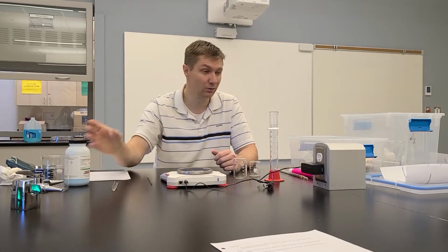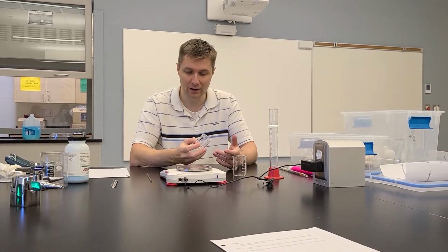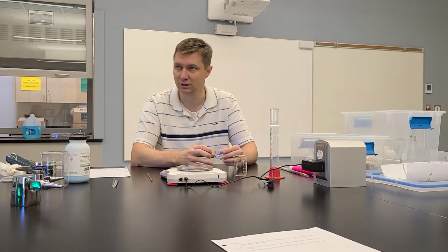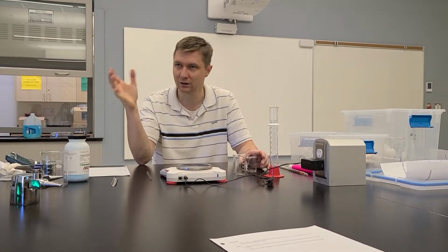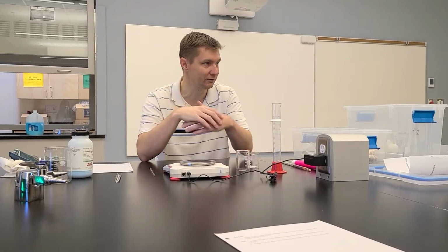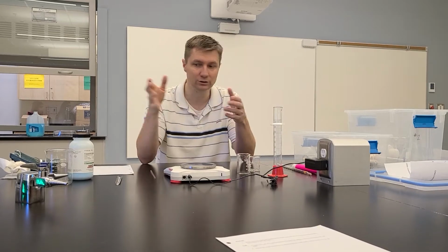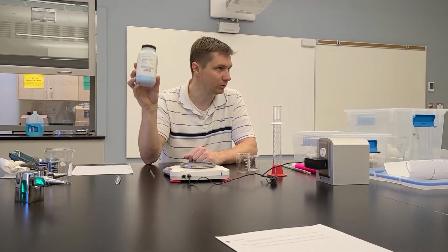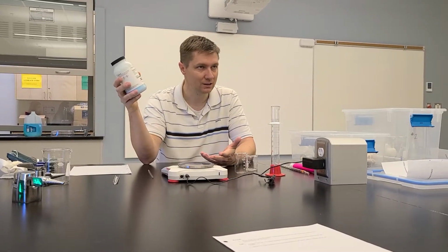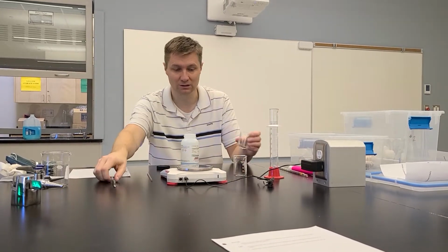And so you've done questions like this in your dilution practice booklet, and essentially all you need to do is convert your milliliters into liters, cancel out your liter unit in the concentration so you're left with moles, because everything in chemistry goes through moles, right? And then once you have your moles, you use the molar mass of copper(II) sulfate to calculate your grams, okay? I'm not going to do that right now, I'm just going to demo for you what this looks like.